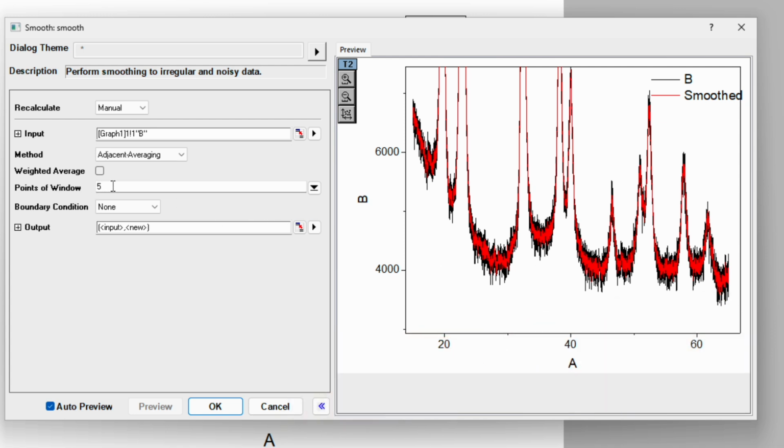Now you can go to the points of window option and change it to, say, 20, and then take a look. You can see the red line is the smooth one and the black is the noisy one, which is the experimental data. So let's consider 10, and this way it can help you to smooth the data.